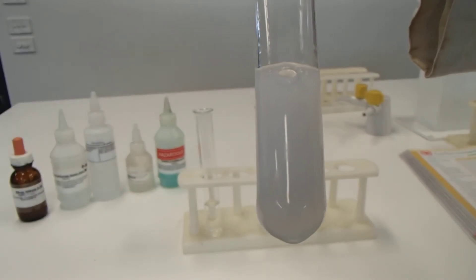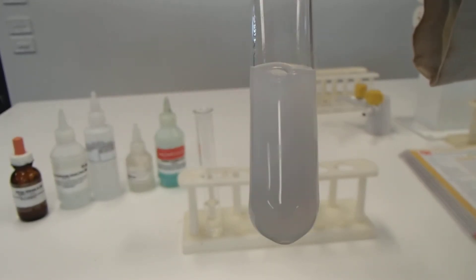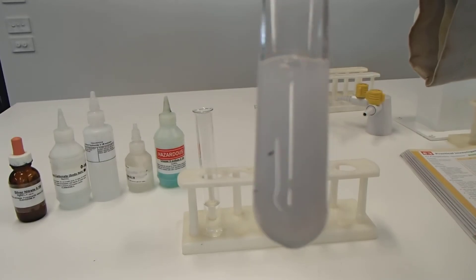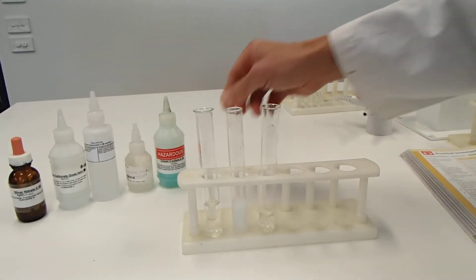Cloudy. White, cloudy. I cannot see through that anymore. Okay, that's gone white and cloudy. So that was sodium carbonate and barium nitrate.